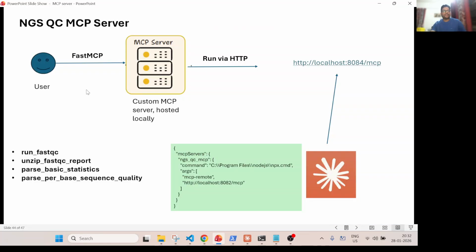The idea is that we will use the FastMCP package to create this MCP server. Then we run it in HTTP mode so that my server will run at a URL. Now we can configure Claude Desktop to connect to this MCP server, and once it is connected, we can run the quality control analysis.